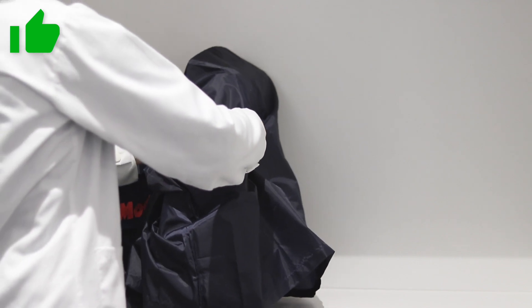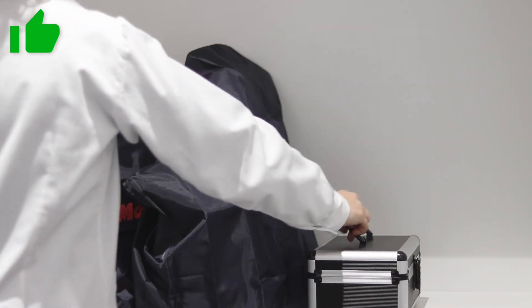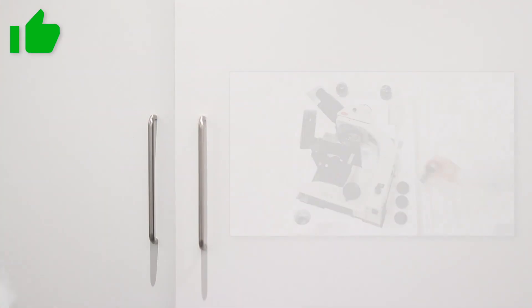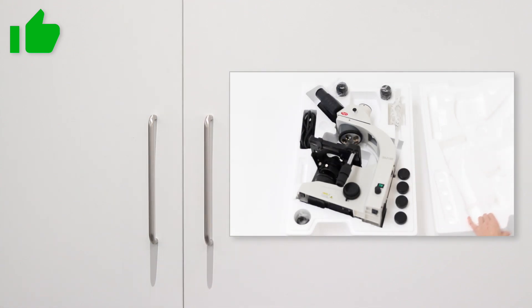When not used for a long period of time, store the microscope in a place with a low humidity level, where mold is not likely to form, protected by its dust cover and, if possible, inside its box.